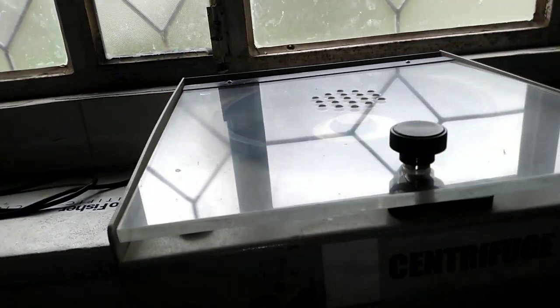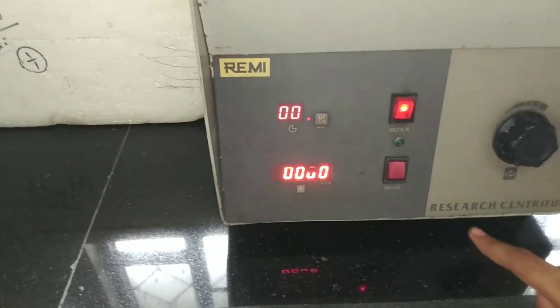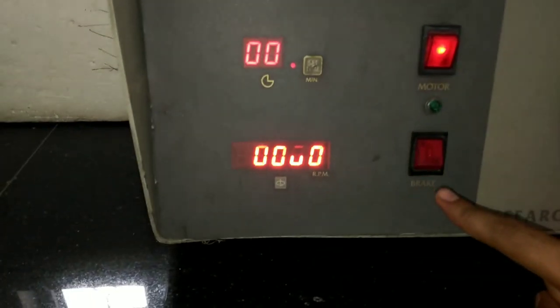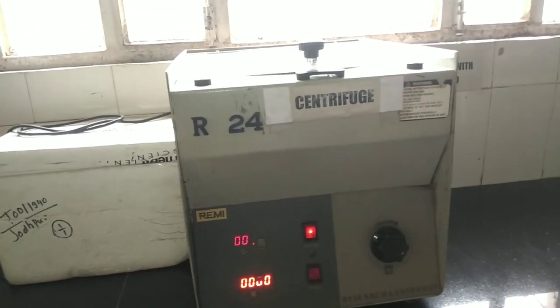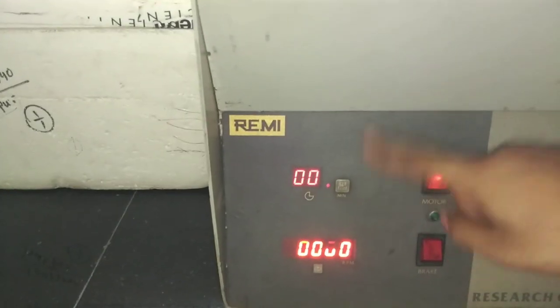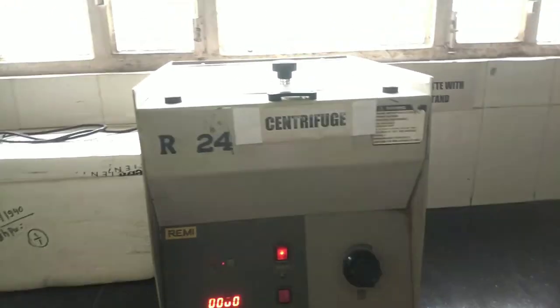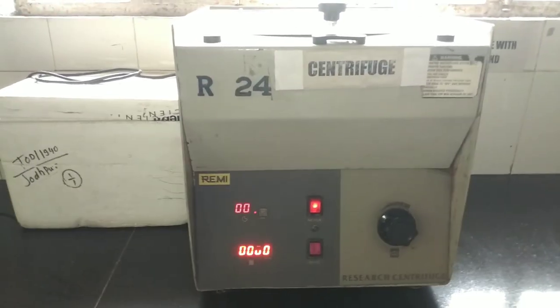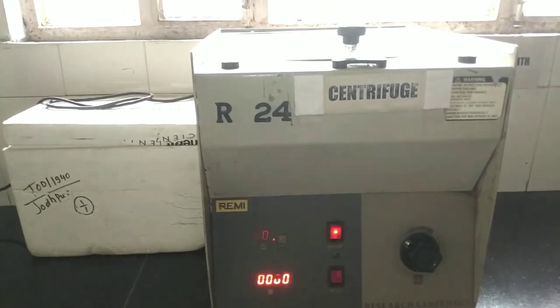After closing the cover, close the safety glass as well. Here you can also see there is a brake on this centrifuge. The operating mechanism is similar — a timer is also present — but this is not a refrigerated centrifuge, so it doesn't show a temperature. It works at normal room temperature. I hope this video is helpful for you.